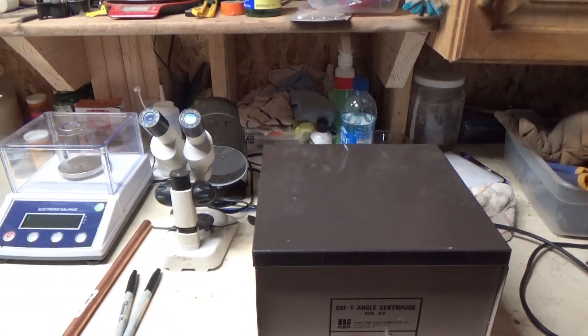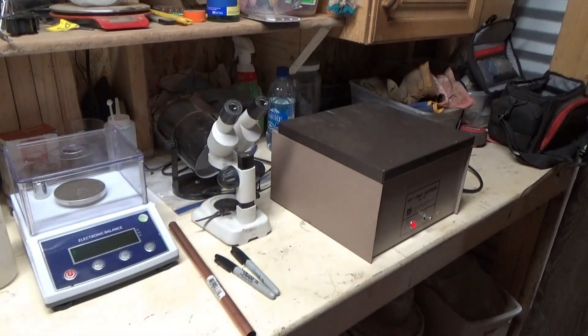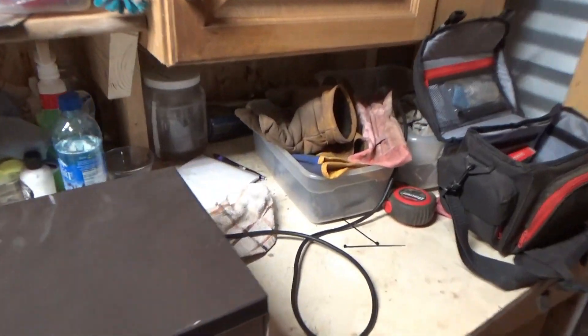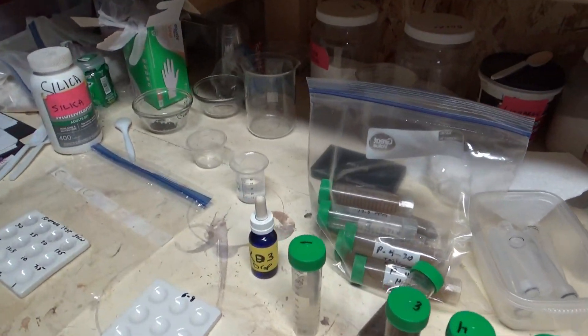So it's coming up to speed. While that spins the sediment to the bottom of the tubes, I got more tubes over here. I'll get those ready.